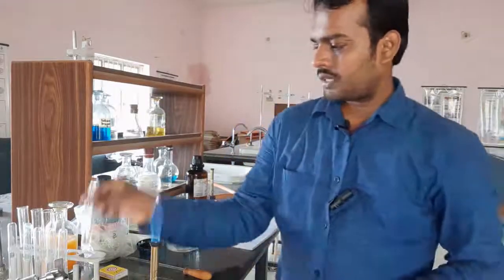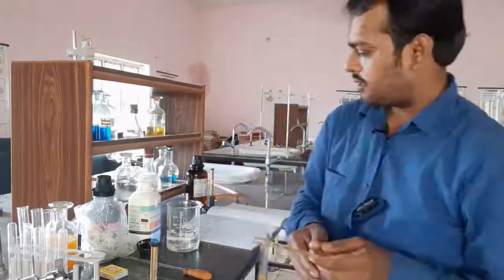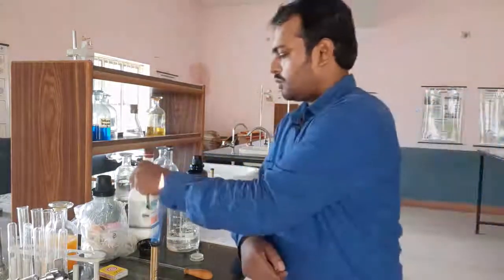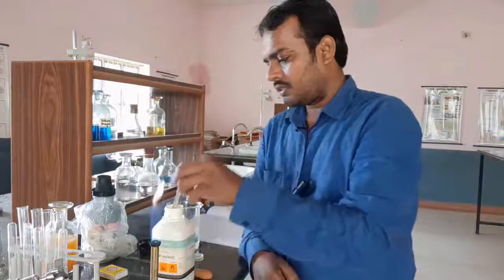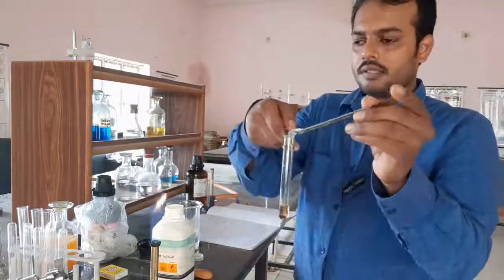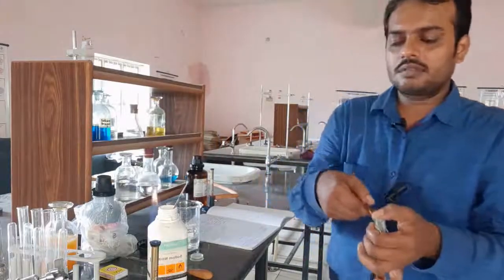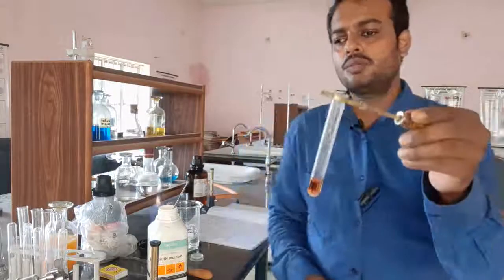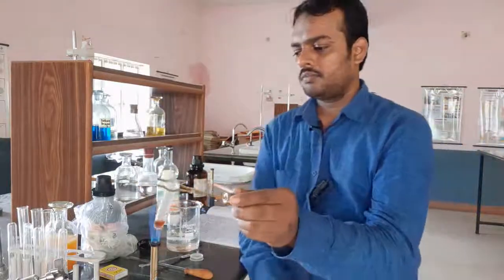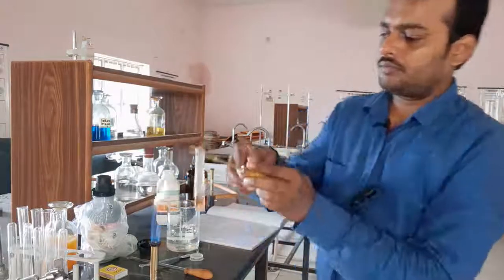For the Liebermann test, we have taken a small quantity of sample in a test tube using a test tube holder. To this, a small quantity of sodium nitrite (NaNO₂) crystals is added. We mix it carefully. The sodium nitrite has been added with the phenol and we will fuse the mass — let us see what happens.